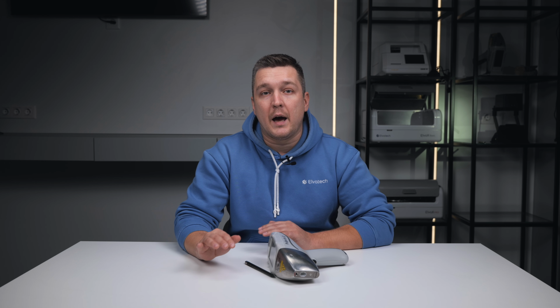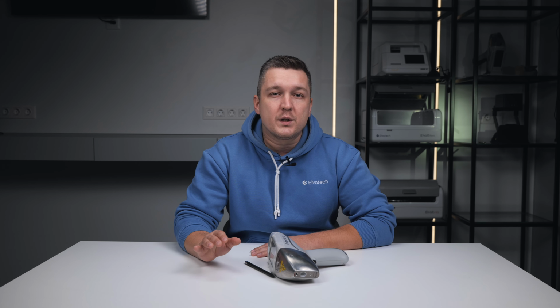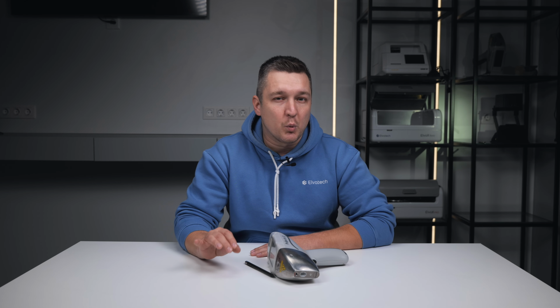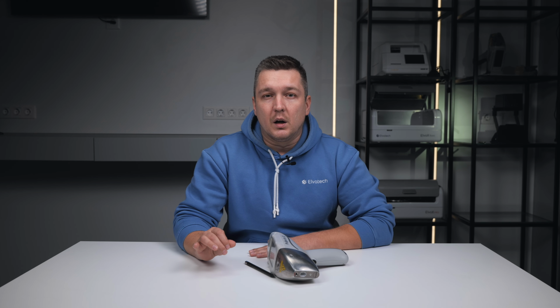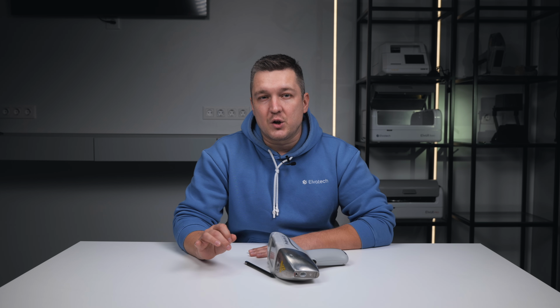The second, measurement time. For rough sorting, a short measurement time is usually enough. But if you work with critical components or compare with the standard, it's better to give the analyzer a bit more time to collect statistics. This improves accuracy, especially for elements in low concentrations.